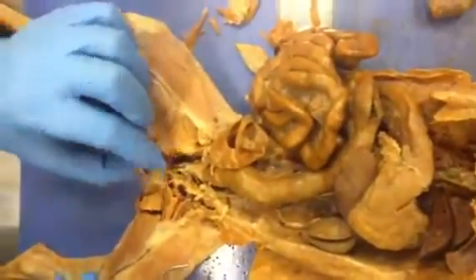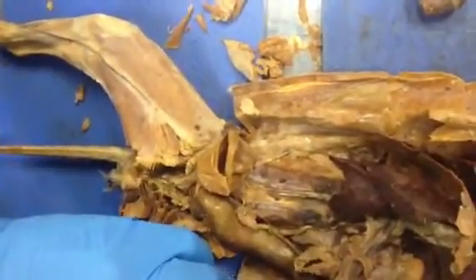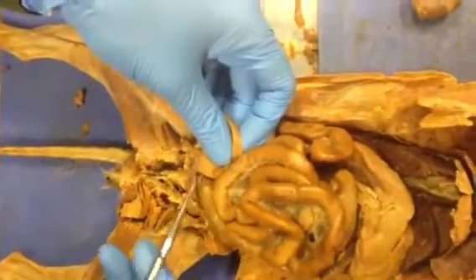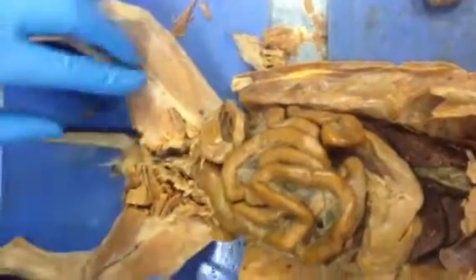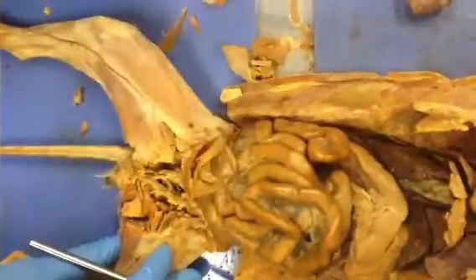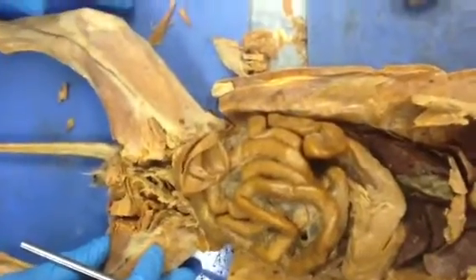So these are the testes. We'll look at that later on. So know the blood supply, know the muscles, the external sphincter, and the internal sphincter, which we cut through here, which you can't really see. But know the diagrams at least, okay? And the epithelium and the functions of the nephrons will include that too. And the next time we'll look at the histology.